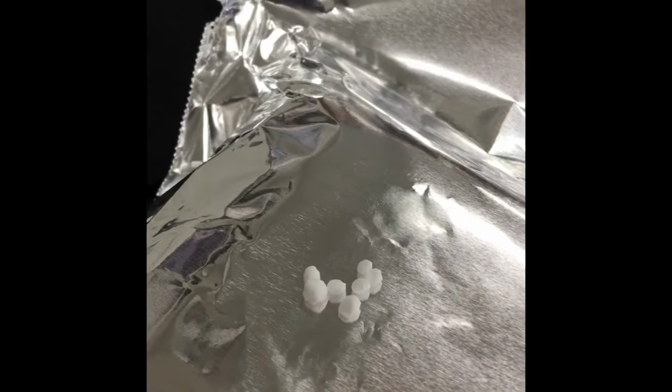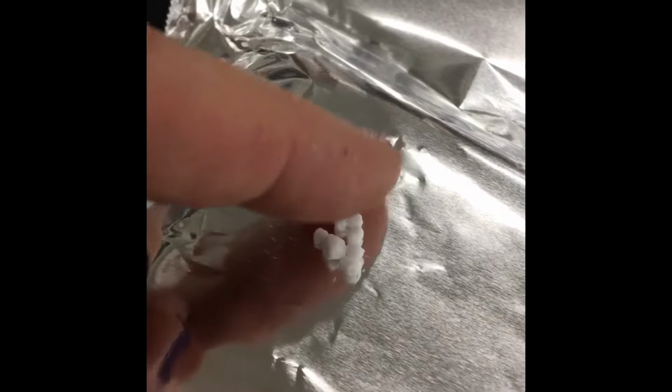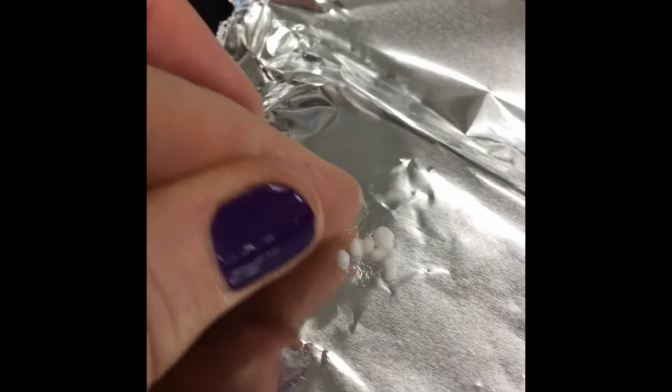Today bringing you some lab data for properties of ionic and covalent bonding. So let's get started. First we're going to observe some of the physical properties. So take a look at this calcium chloride. Notice that it is white. It's solid, not liquid or gas, and it appears to be crystalline. It's kind of hard, brittle, like a crystal should be.